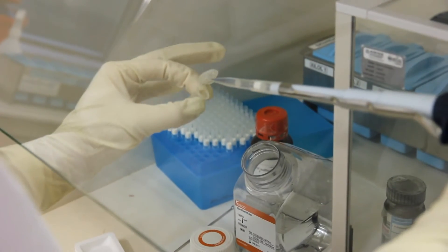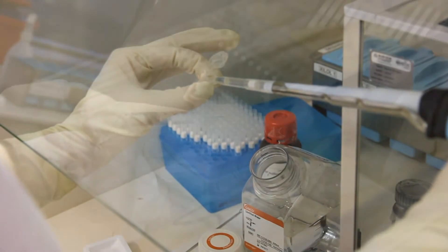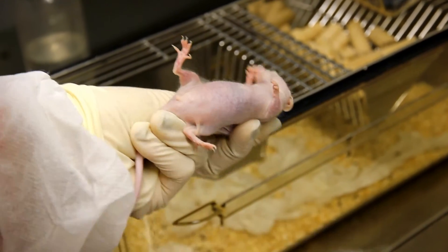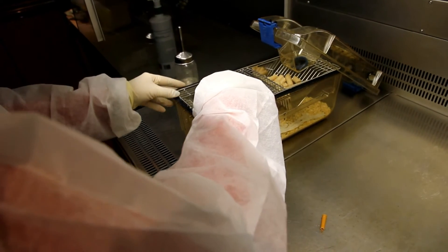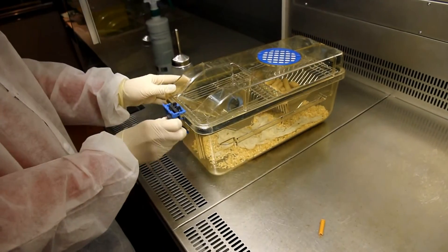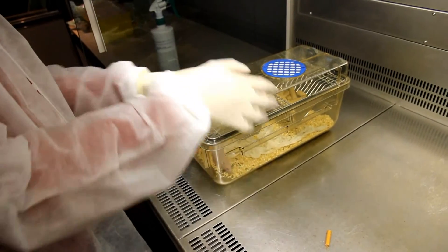Make sure that it is completely dissolved and keep it warm using a 40 degrees heat block. Load dissolved busulfan into a 1 ml syringe and inject it to the mice via intraperitoneal injection. It is also important to transfer treated animals to clean cages 2-3 days after the injection. Then discard the soiled bedding through the hazardous waste stream since busulfan is secreted in urine.